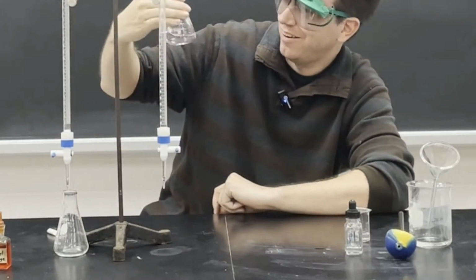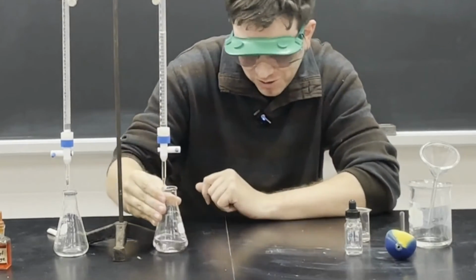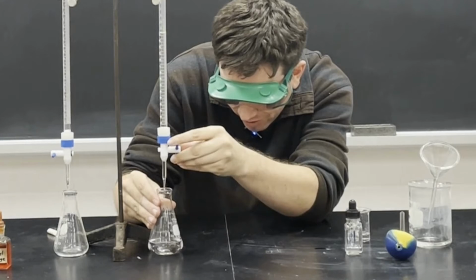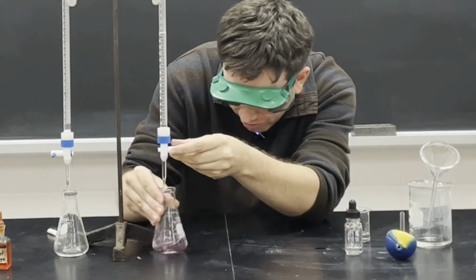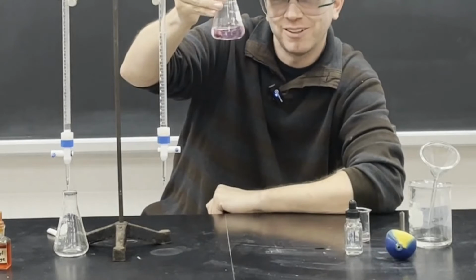Did I get it? Is that gone a pinkish? Let's try one more drop. There we go. There's our baby pink.